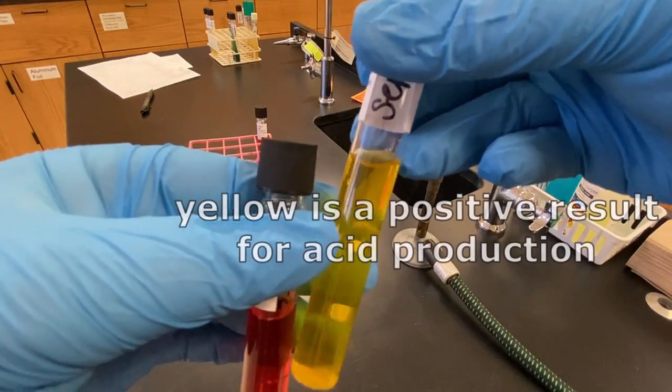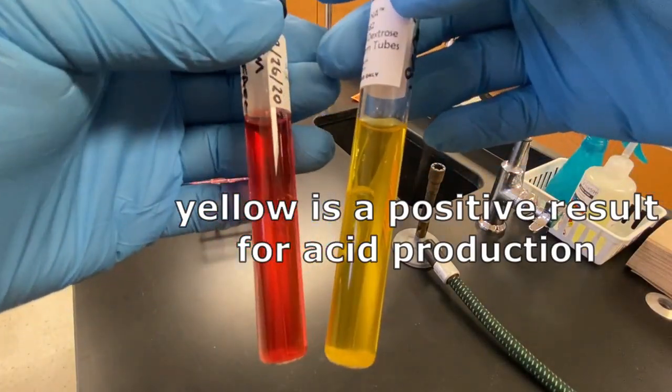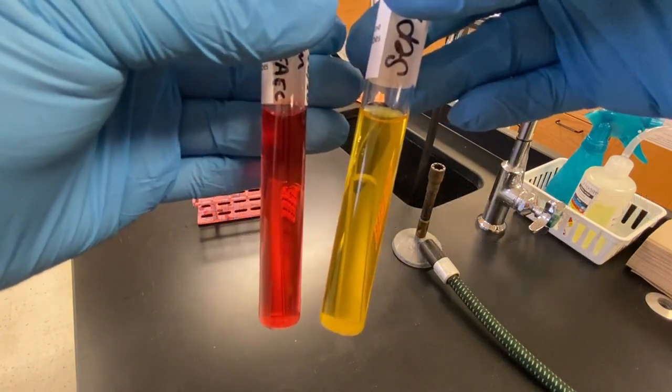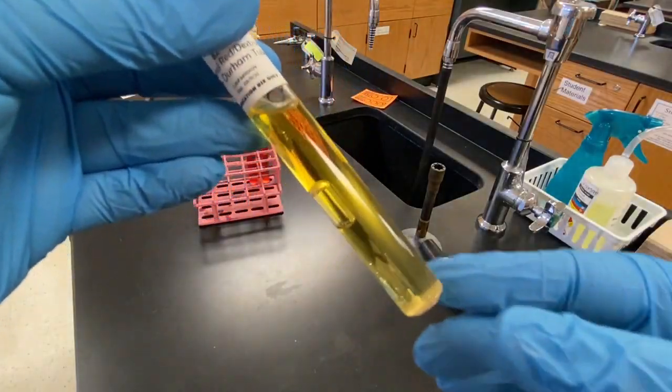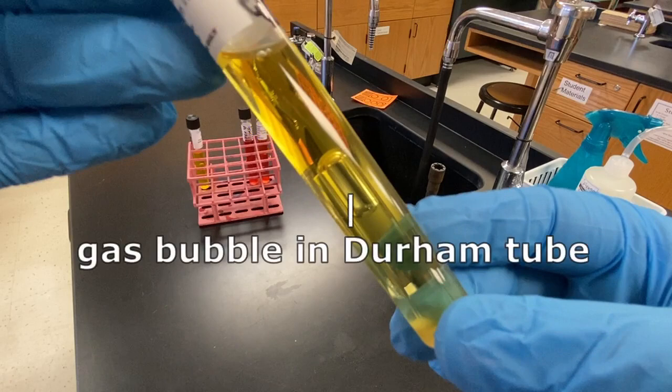Here is the expected result from S. epidermidis. The acid products of fermentation have lowered the pH of the broth and the indicator has turned yellow. This is Enterobacter aerogenes in the dextrose PR broth. The microbe has been able to ferment glucose to produce both acid and gas.